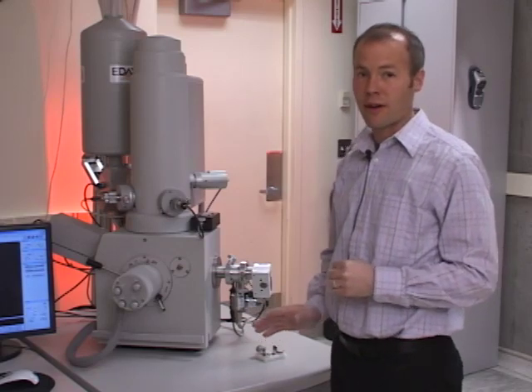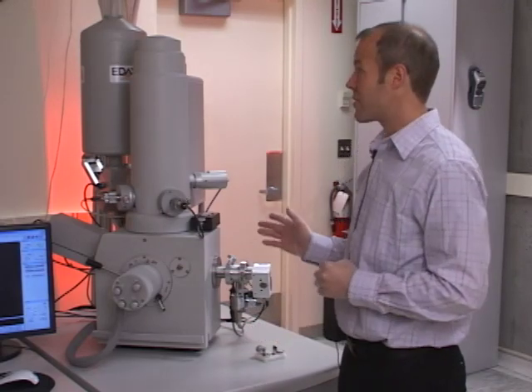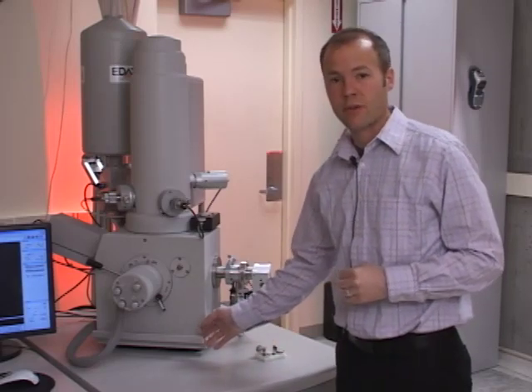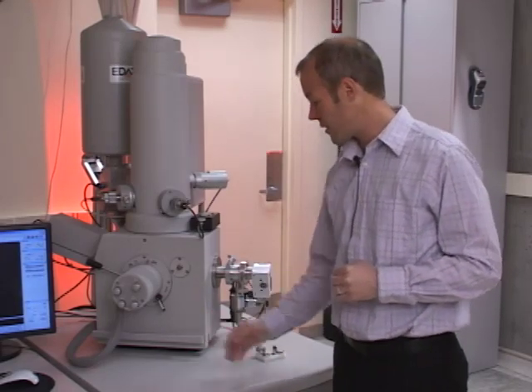At that time this door will open easily. There's actually no indication on the software or any place else on the machine that the chamber door is ready to open. You simply have to watch the clock for about two minutes to pass, or just keep retesting the door lightly with your fingers on the handle like this.